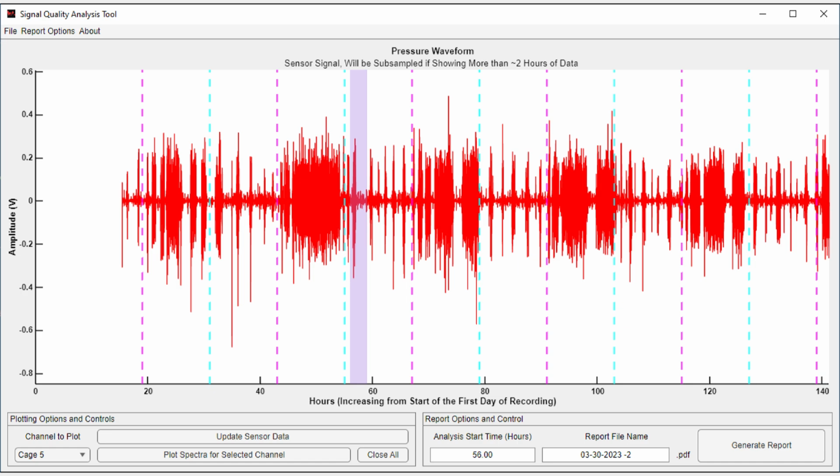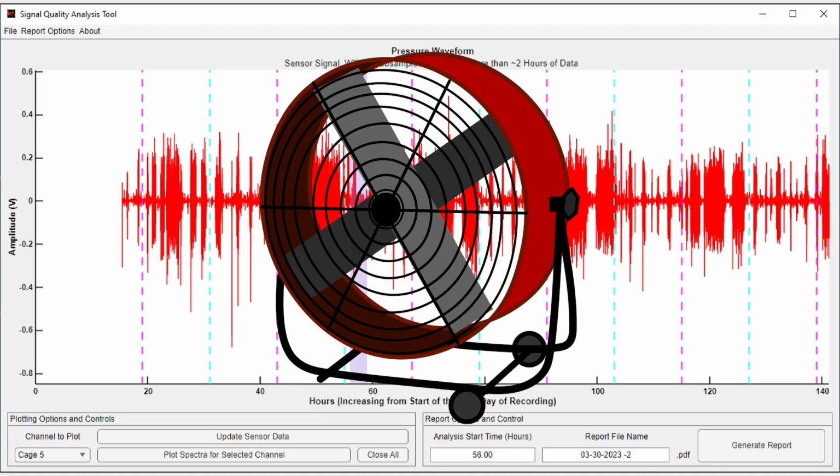For SNR assessment, there must be an animal occupying the cage of interest to generate a signal, and the recording must be long enough to contain extended periods of low activity. It is recommended that the recording be at least 24 hours so the cages are exposed to a full cycle of building activity and machine activation, such as from human foot traffic and ventilation systems.